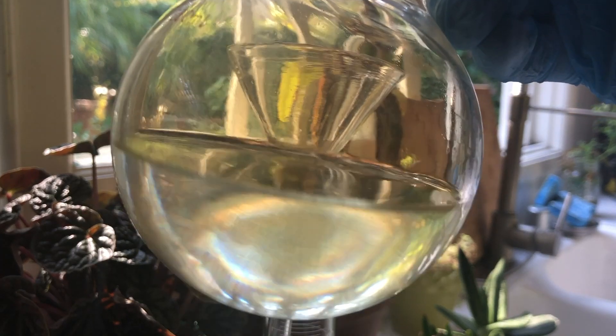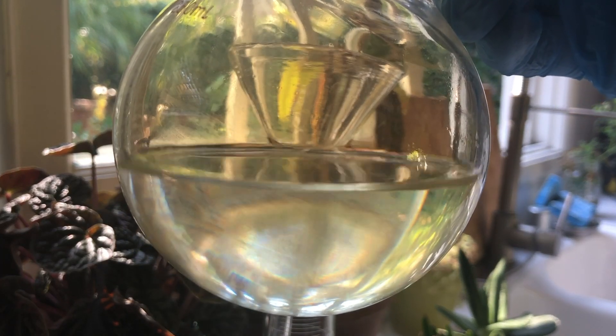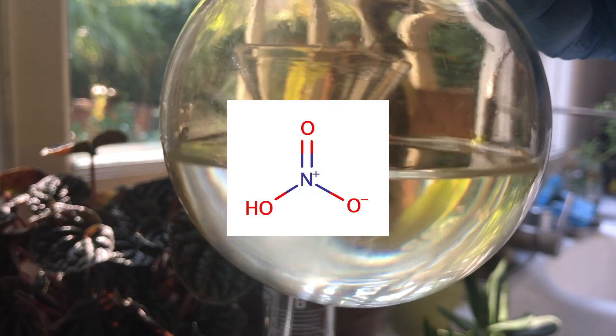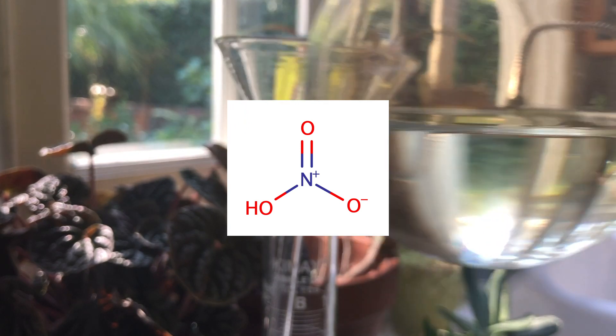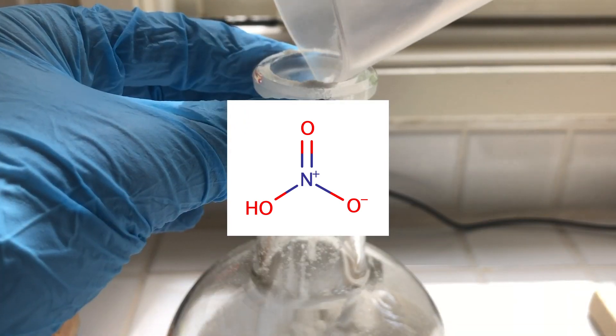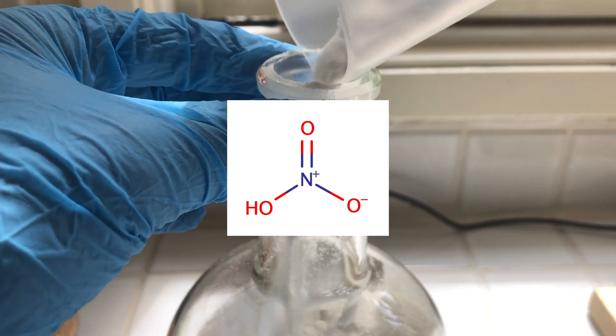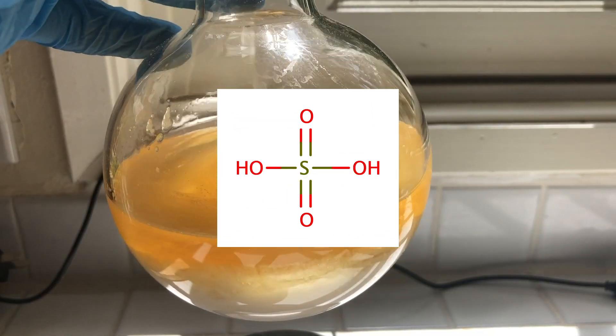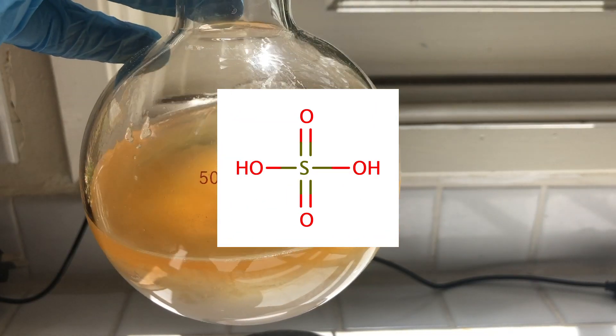Hi and welcome back to Thor's lab. Today I'll be making some concentrated nitric acid, also called azeotropic nitric acid, using potassium nitrate and sulfuric acid.